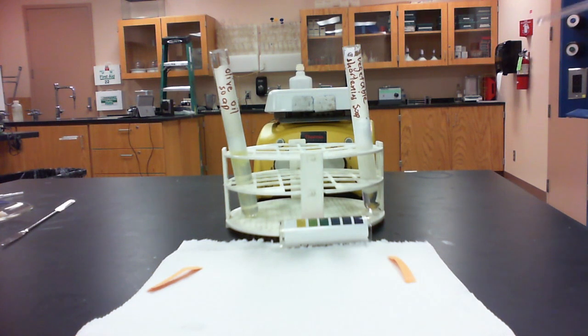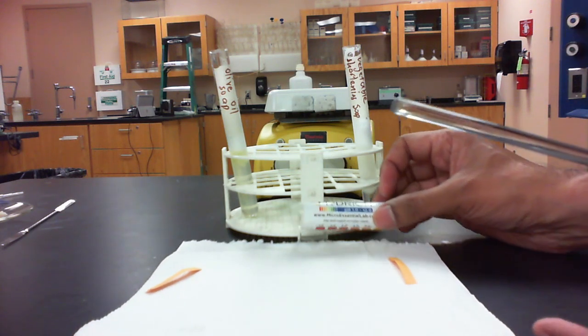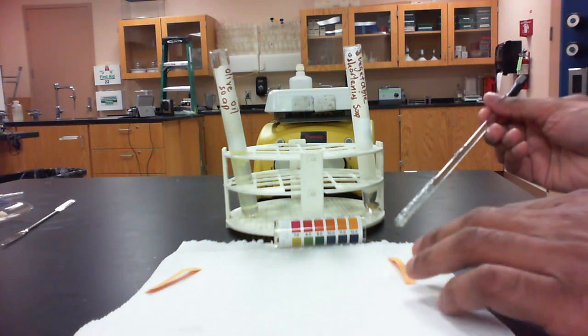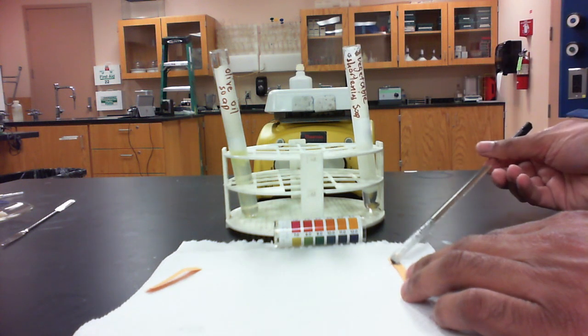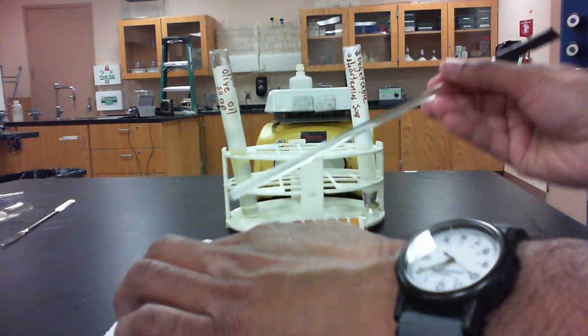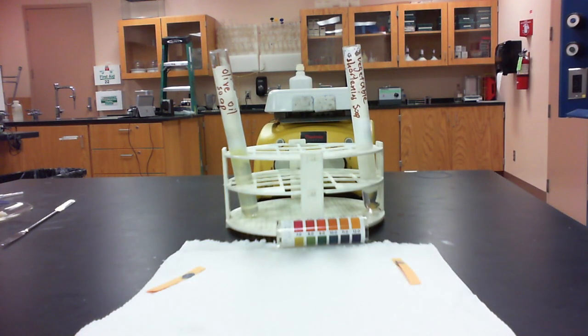The next test we're going to do is to test the pH of the resulting solutions that we made, and we're going to use our pH paper that you used back in the acids and bases lab. And to do this, all we need to do is to just get a clean stirring rod. We touch it to the solution, and then we touch it to the pH paper. All right, we're going to do the same thing. We're going to clean our stirring rod, and we're going to test the pH of the olive oil soap. Okay, and we're going to match that color up to the color on the color wheel.